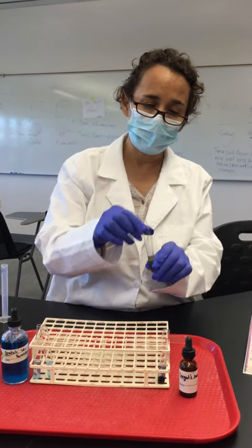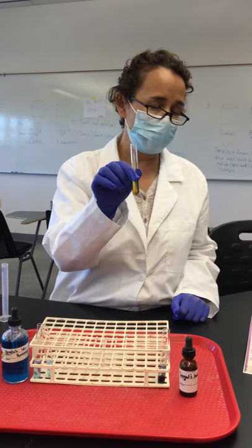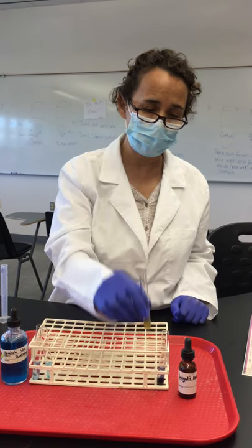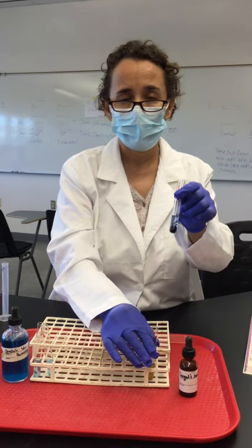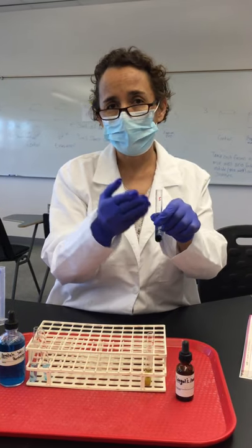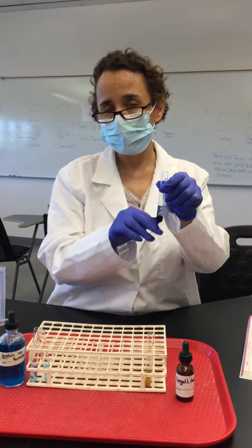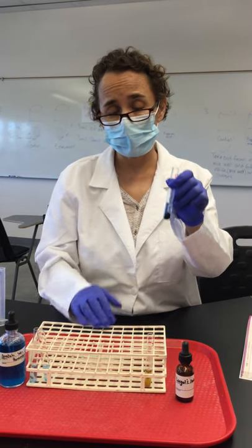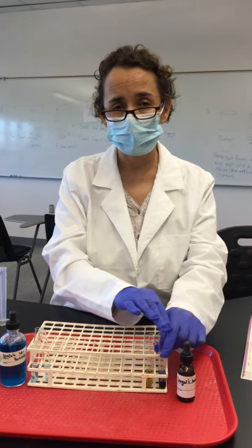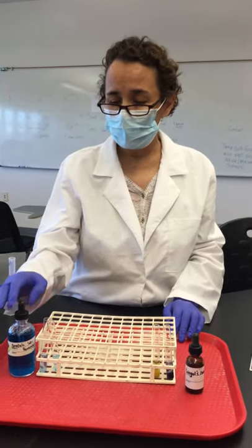In tube 3, we have starch and amylase, so digestion has occurred. In the other tube, we only have starch and water. Water alone cannot digest carbohydrates, which is why starch is still present and was detected by the Lugol solution.